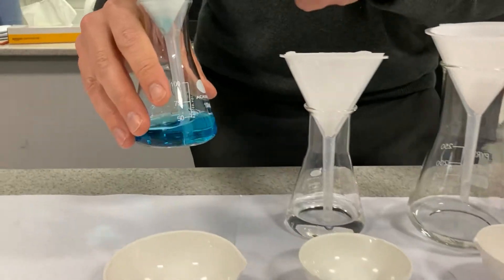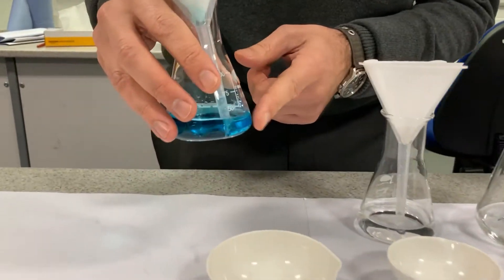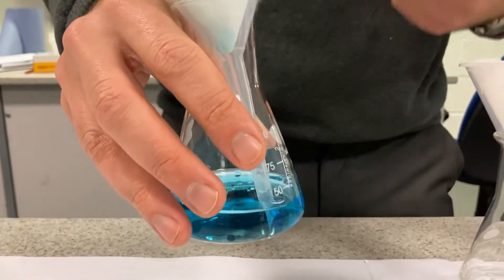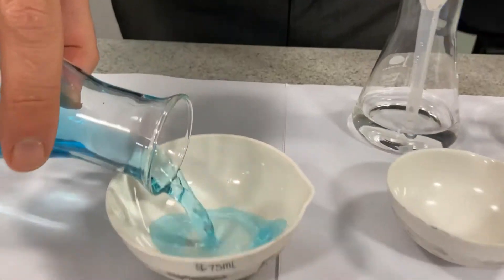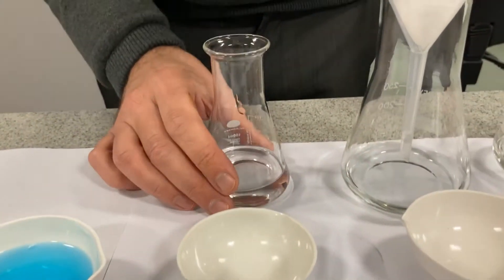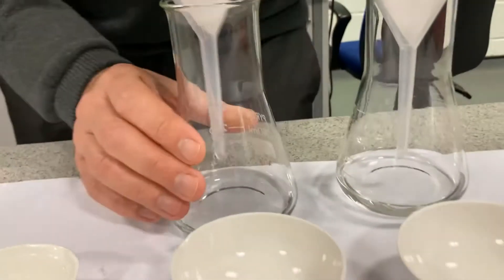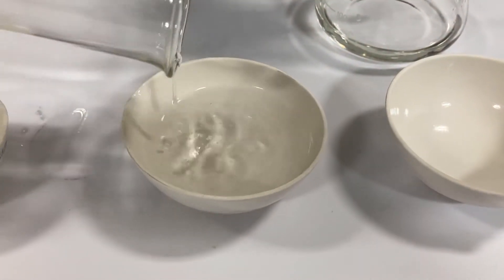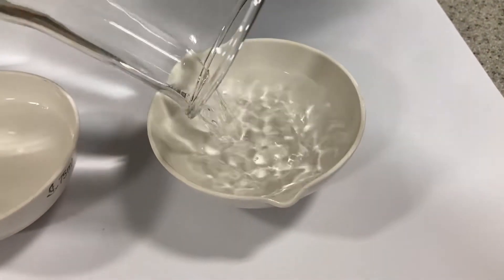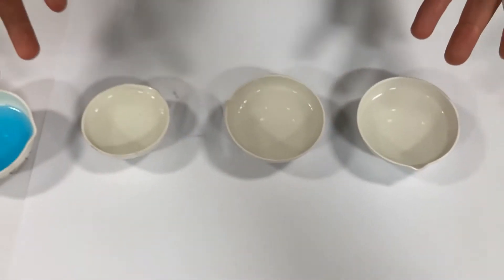These are the substances that dissolved — they've gone straight through the filter paper. The copper sulfate looks like it's gone straight through because it's still blue. What I'd like to do is pour it into a bowl, leave it for a few days, let the water dry out, and see what it looks like. One of the other solutions is sugar and one is salt, and there's also ammonium chloride — another type of salt. Those three look clear — nothing visible — but we'll come back to them in a few days and see what's in there.